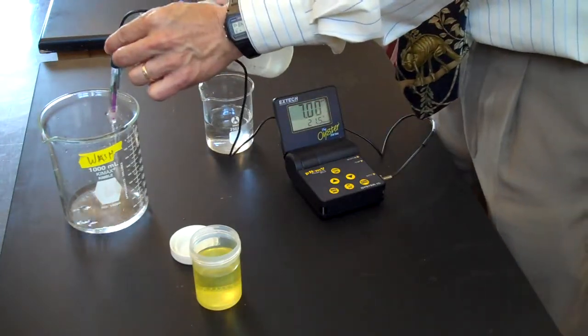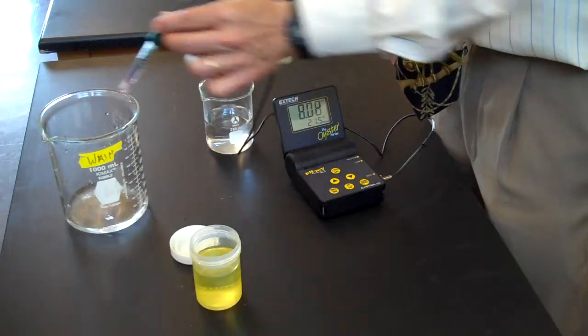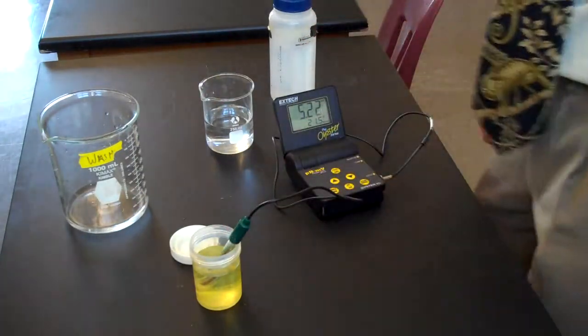Rinse off my solution. Put the electrode back in its original home.